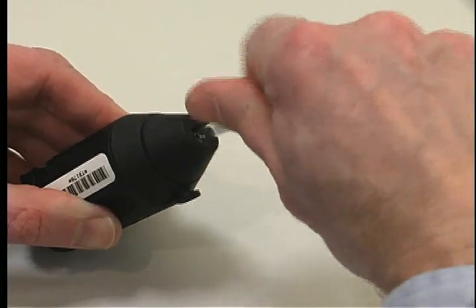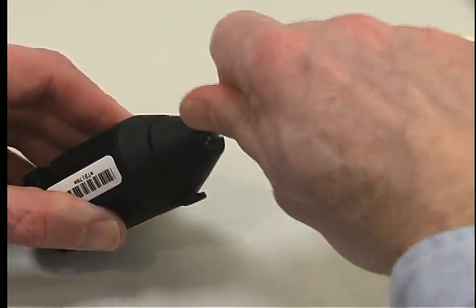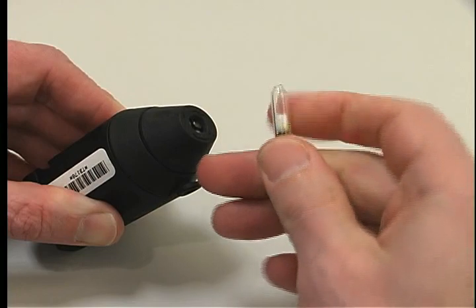Using a tube breaker, break both ends of the tube to provide an opening at least one half the internal diameter.